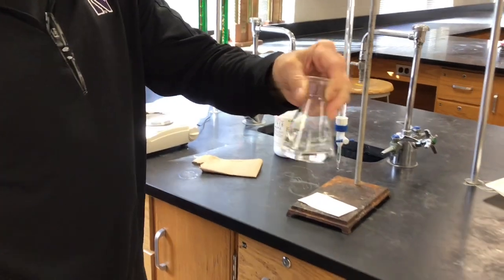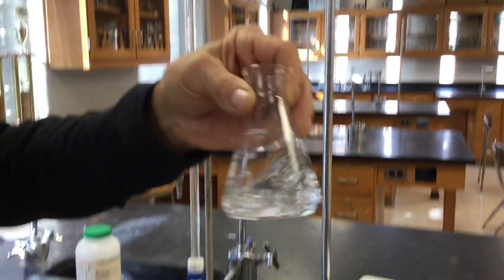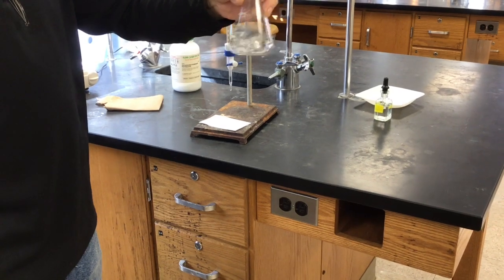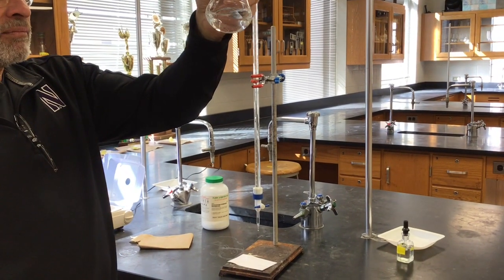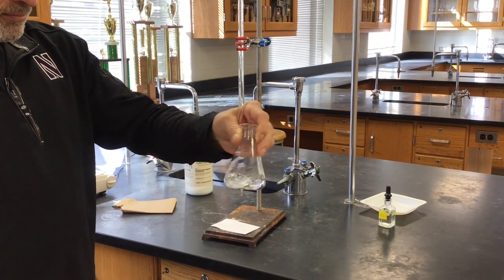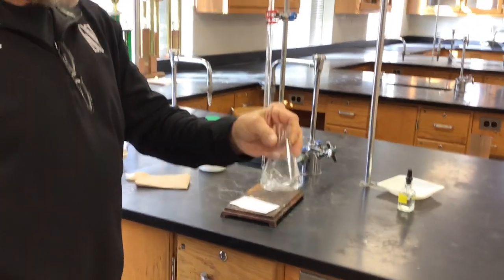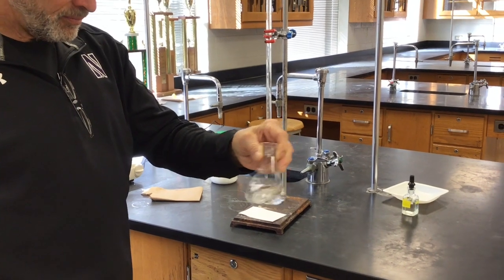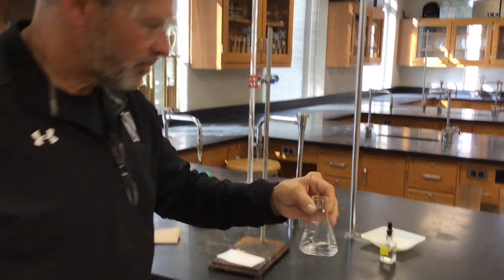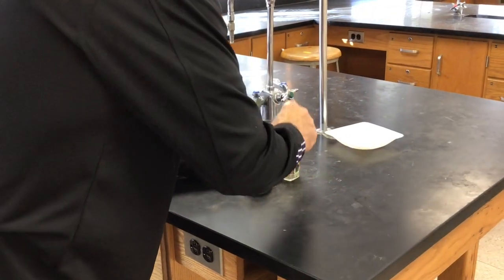Okay, we have another stubborn acid that doesn't like to dissolve. Yeah, I still see some in there. Just got to be patient. Get it to dissolve. Put in the phenolphthalein, then give it a few more swirls, and then let Mr. Moore look at this.